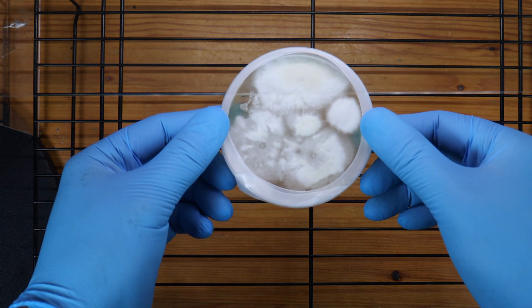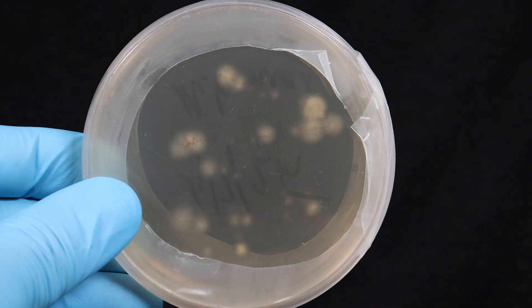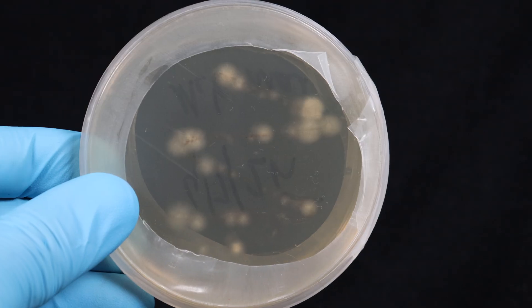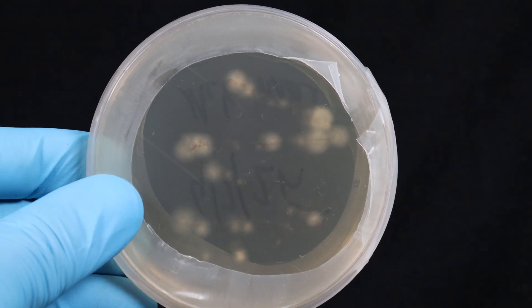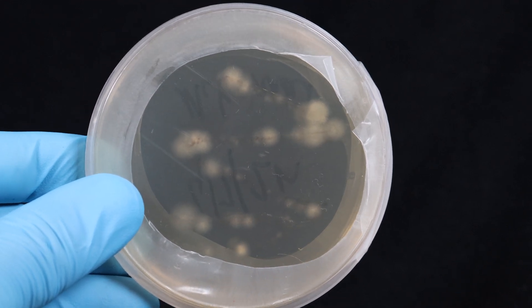All right, with your plate sealed and incubating in a warm environment, let's check in on them after about seven days. And here we can see a bunch of germination points. Fantastic. Look at them all. Exactly what we're after.